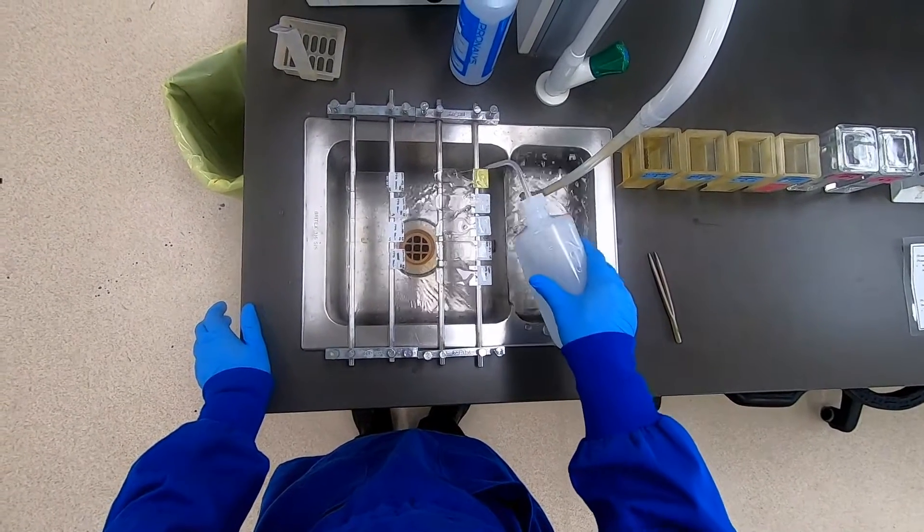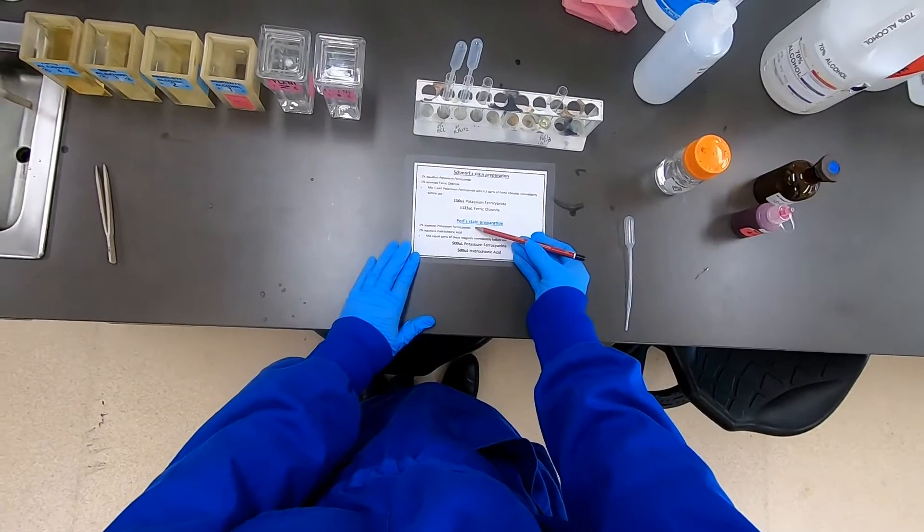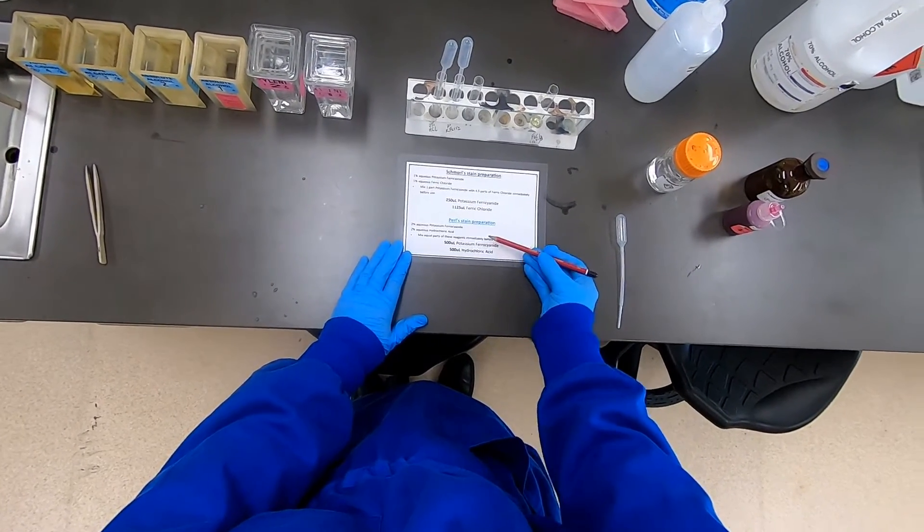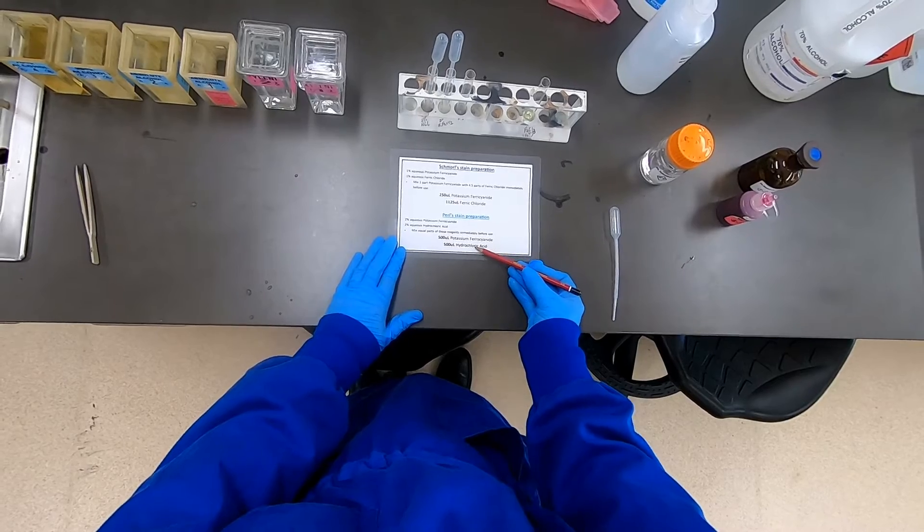Once we've done that, we want to give those slides a good rinse in deionized water, especially for a stain of this type where traces of iron in the water could lead to contamination issues.